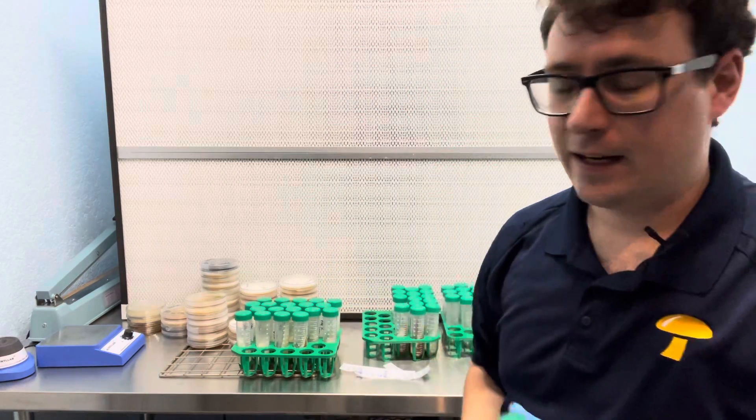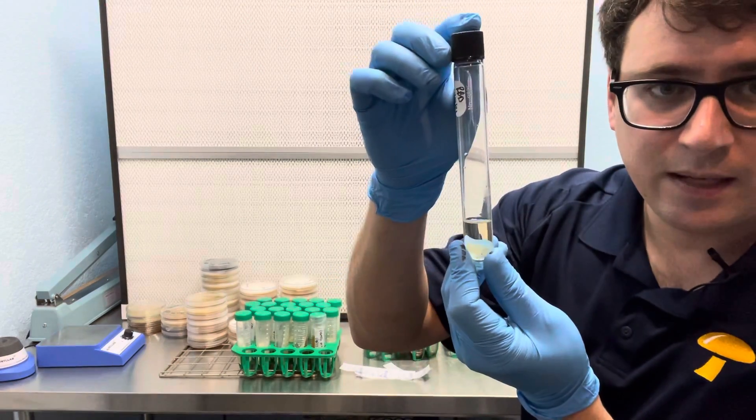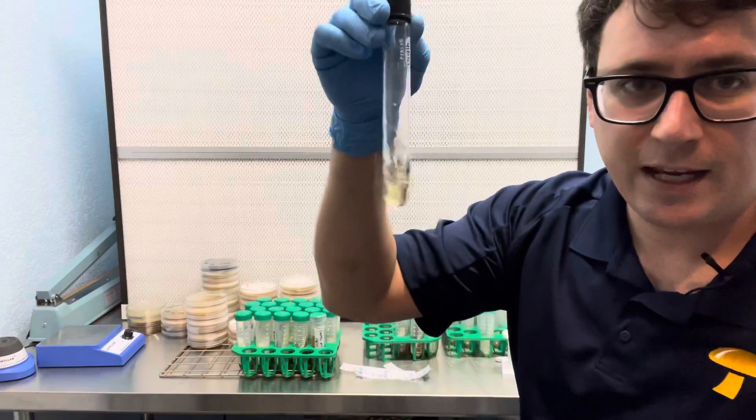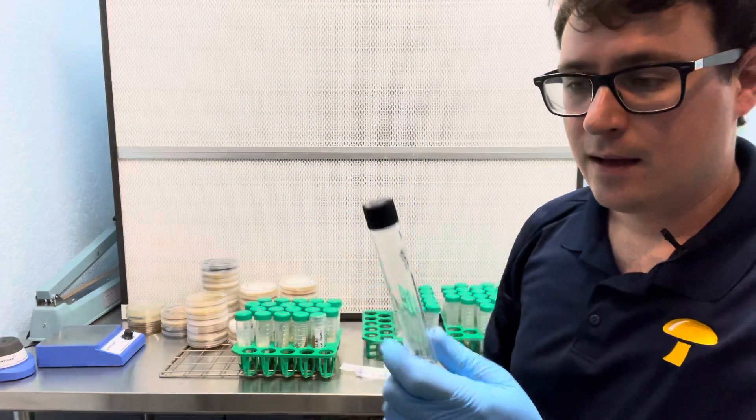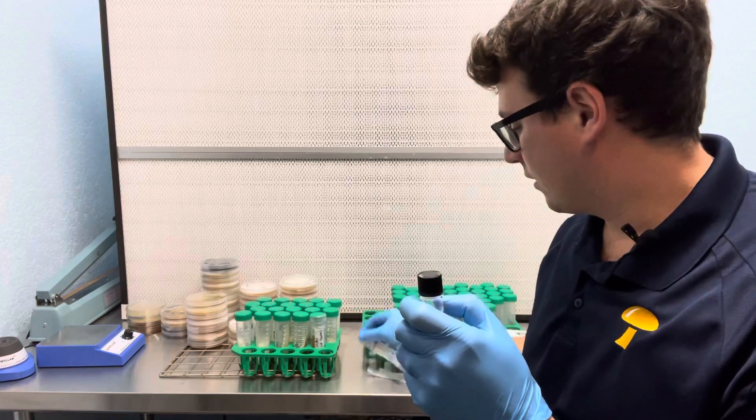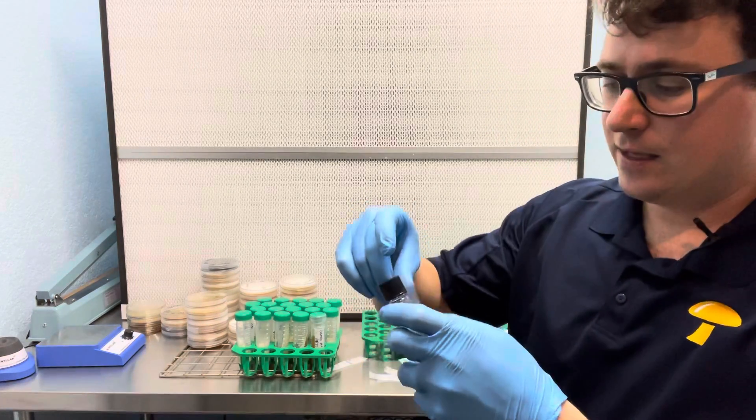And also if you are using the glass tubes this is a rosebud that I've been bringing back from freeze drying but oftentimes these lids will get pretty loose too so it's a good idea to parafilm these glass tubes as well.